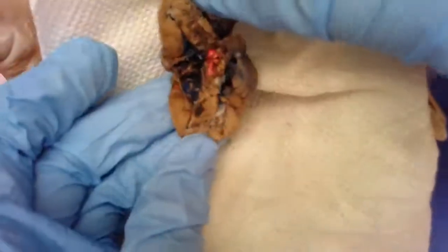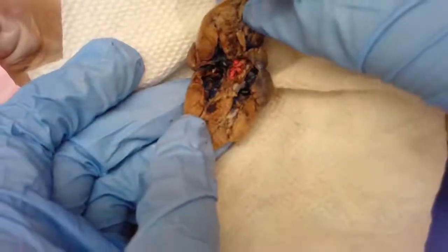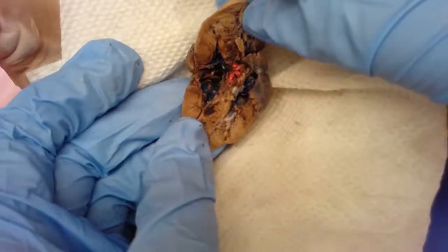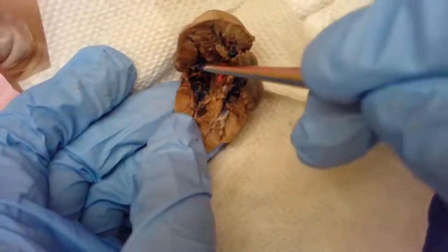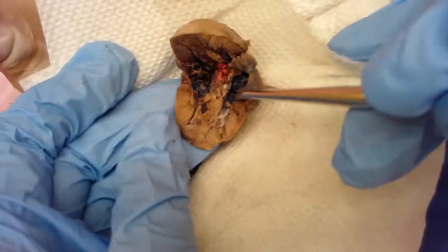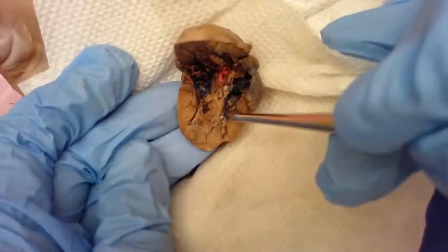Here's the inside of the heart. There's tons of blue and pink latex. The blue latex would be representative of blood that was coming from those vena cava — the anterior and posterior vena cava — and they were coming from the right atrium into this right ventricle. And then over here you would have had the left atrium up here at the top and the left ventricle down here at the bottom.